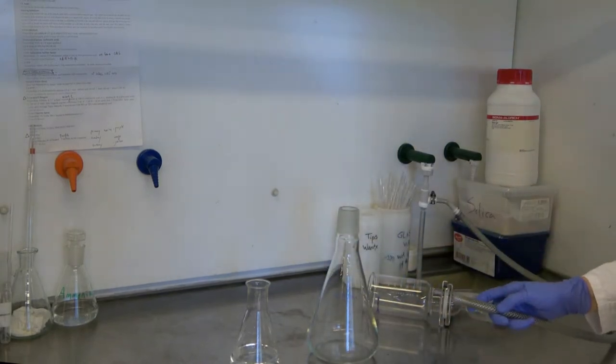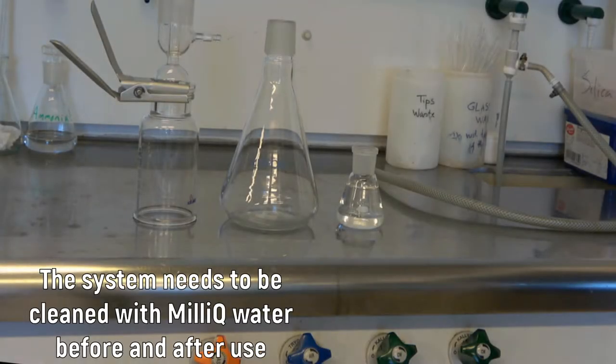After use, the filtration system should be cleaned again. It's then left to dry on a paper towel in the same place where it was first found.